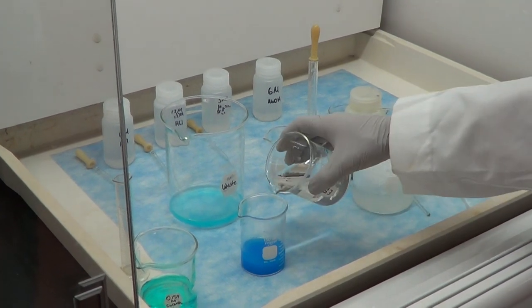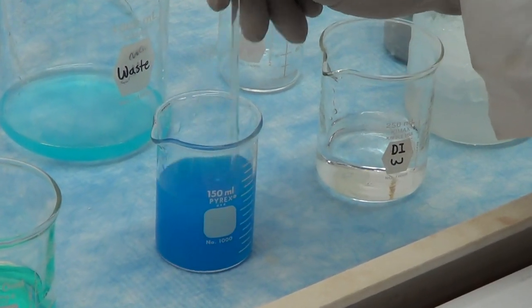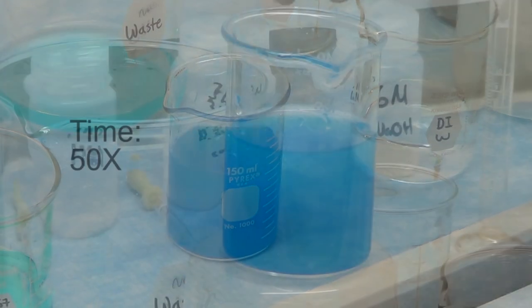This is the third and the final wash where we will see clearly the precipitate settling down at the bottom of the beaker.